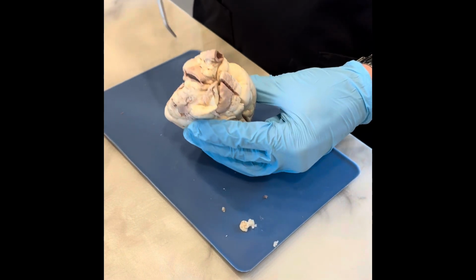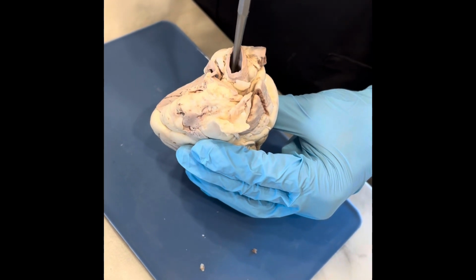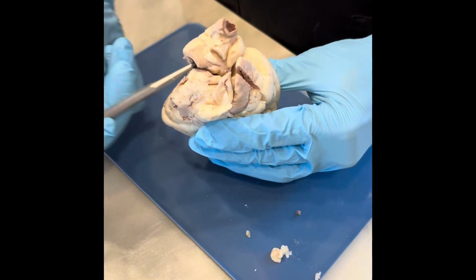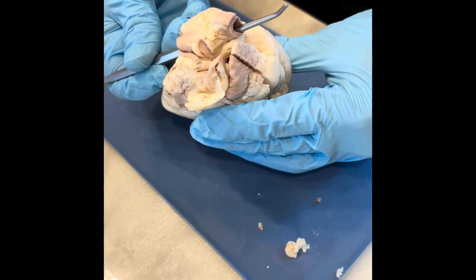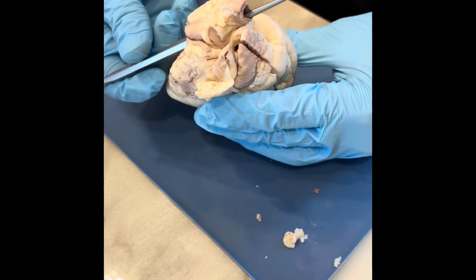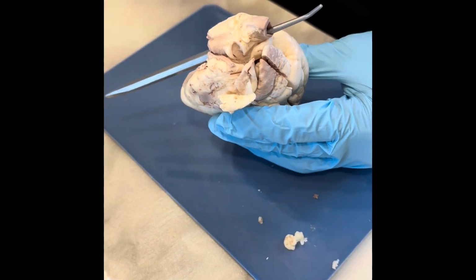At the top here, we can see the aorta right there, which is a large artery that carries blood to the systemic circuit. Right next to the aorta is our brachiocephalic trunk, which now the probe is going through. This artery branches off the aorta, which gives off vessels that supply the right side of the head and right upper extremity. Remember, an artery is a blood vessel that carries blood away from the heart, while veins return blood to the heart.